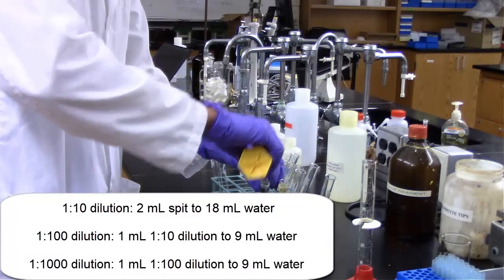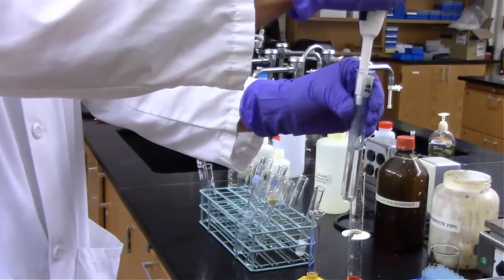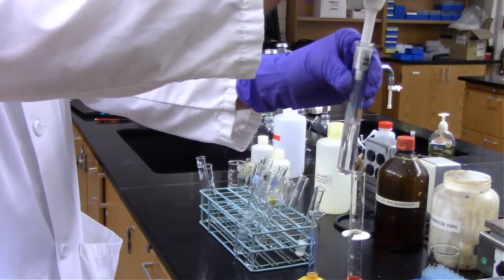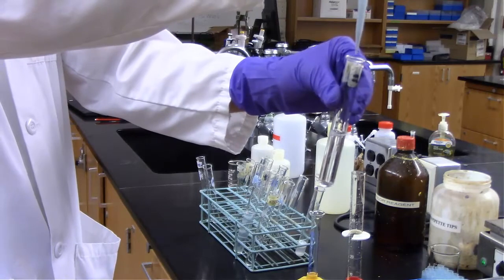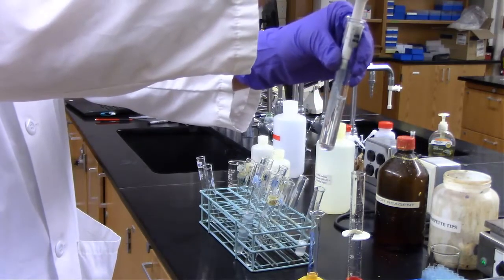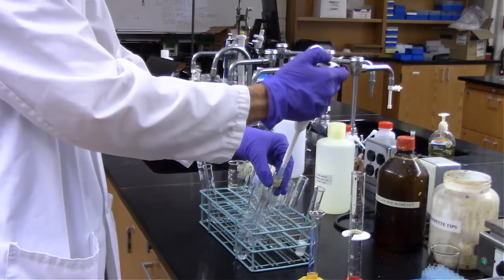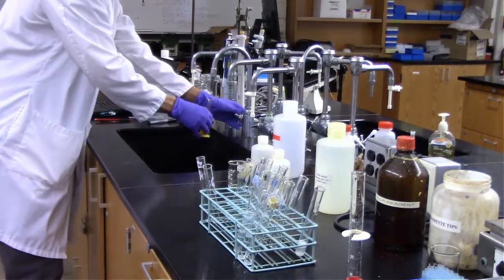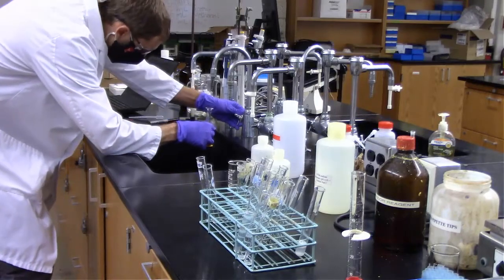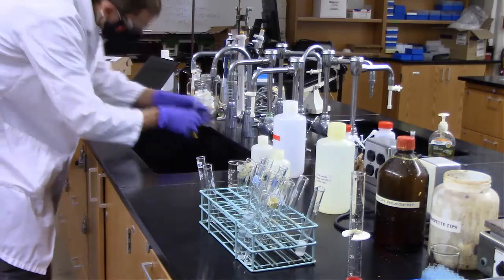After we make that 1 to 100 dilution, we're going to make sure we stir that really well, and then we're going to take a milliliter from that. So that needs to be thoroughly stirred to make sure that some of my saliva is definitely coming with that to make the 1 to 1000 dilution. So essentially we're going to dilute that tenfold again to make the 1 to 1000 dilution. So right now I'm getting 9 milliliters of water in that graduated cylinder.